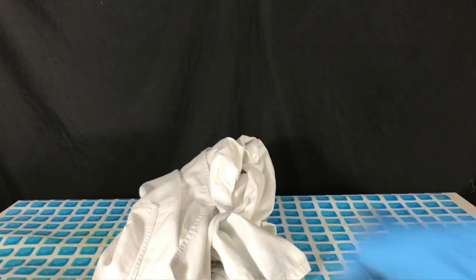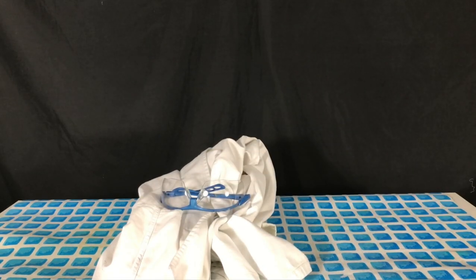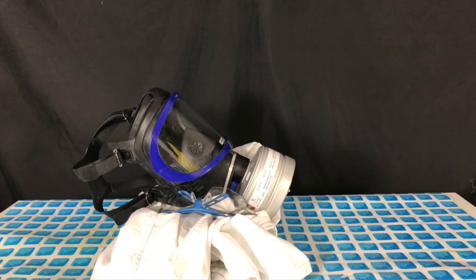Obviously sulfur trioxide is really dangerous, so a lab coat will be worn throughout the preparation. At the beginning we will wear safety goggles, because no sulfur trioxide fumes are generated, and when the sulfur trioxide starts being generated, we are going to put on a gas mask.